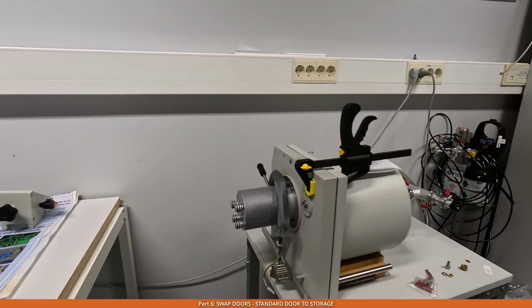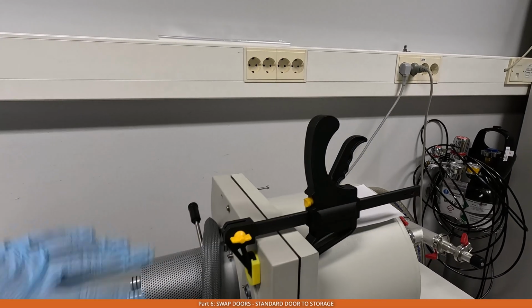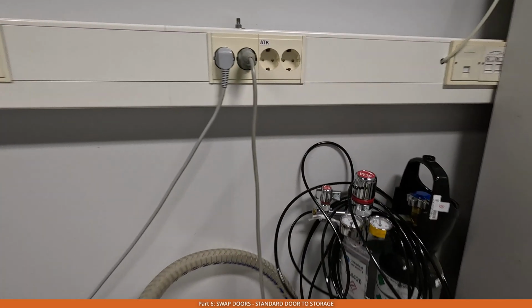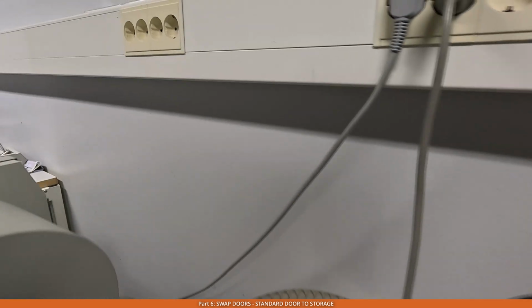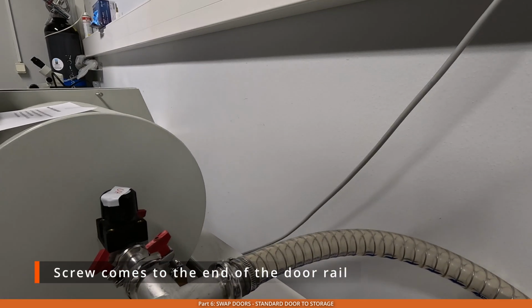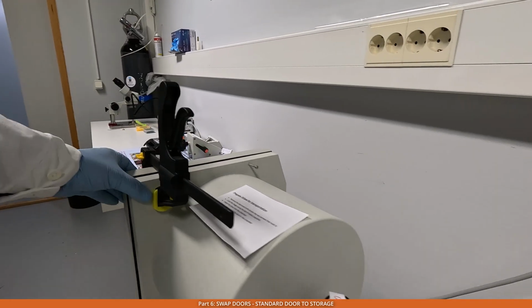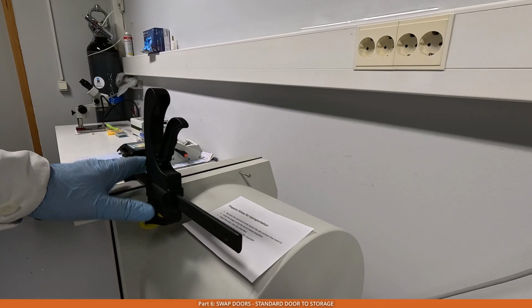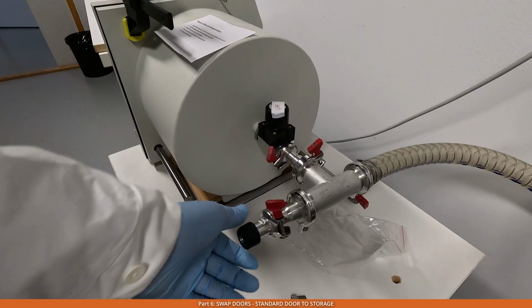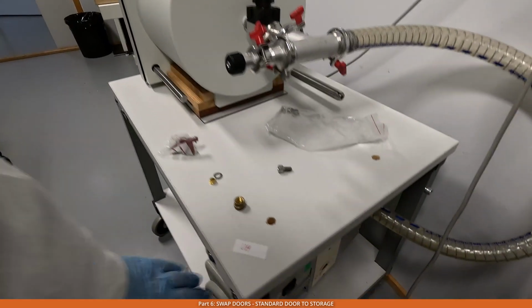The next step is to pump the chamber. I have already put this lock mechanism to make sure that the door won't fall apart. Optionally, it's possible to use a similar screw and put it on this side to make sure that it won't fall apart. But typically the screw, or this lock mechanism, is enough. Now I will close this valve and open this valve and then start the pump.